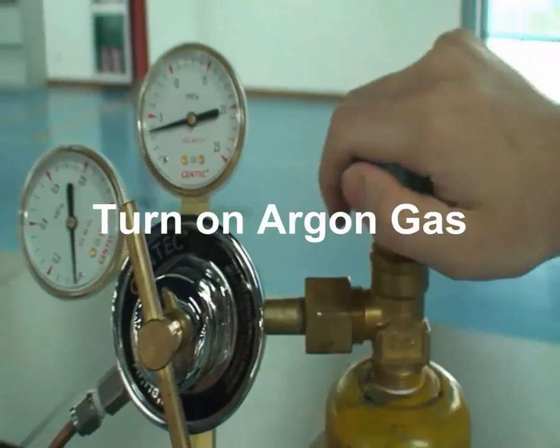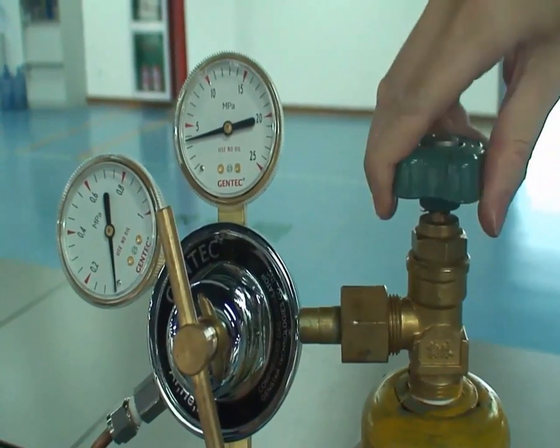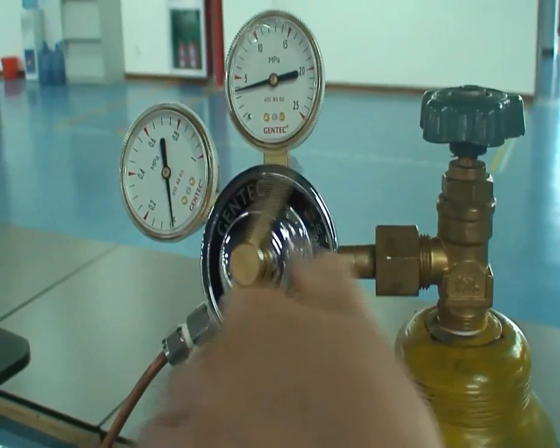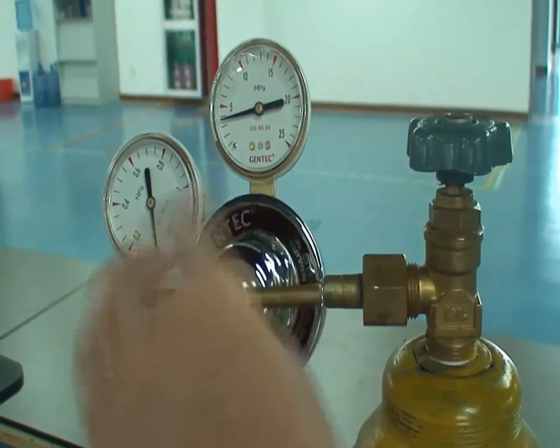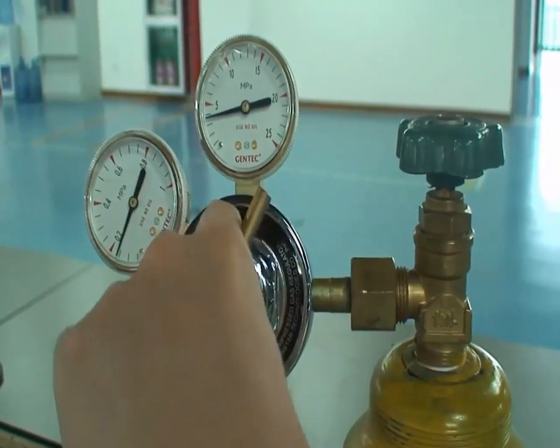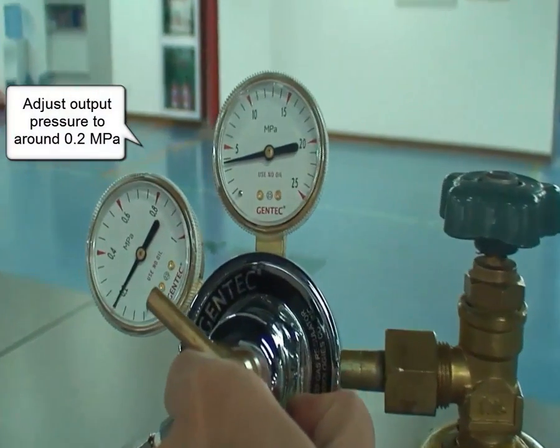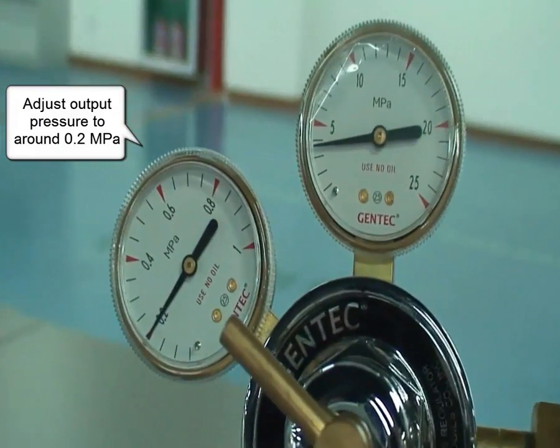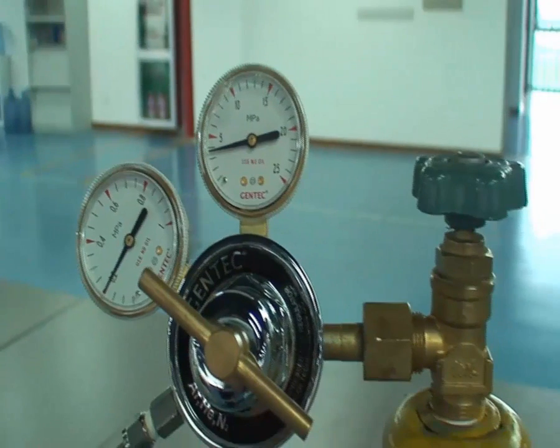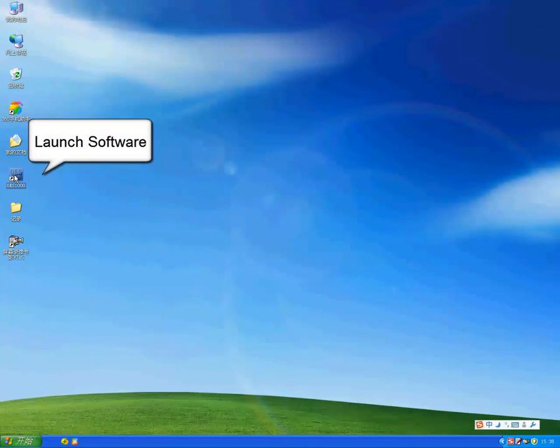Before test, turn on argon gas cylinder. Turn on the main valve first, and then adjust output pressure to around 0.2 MPa. Launch software.